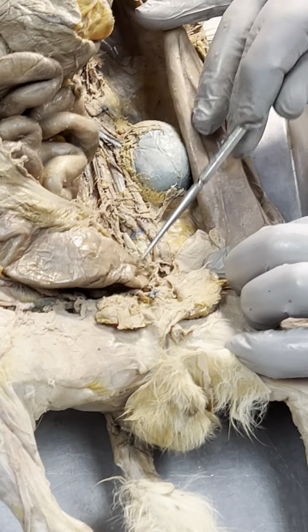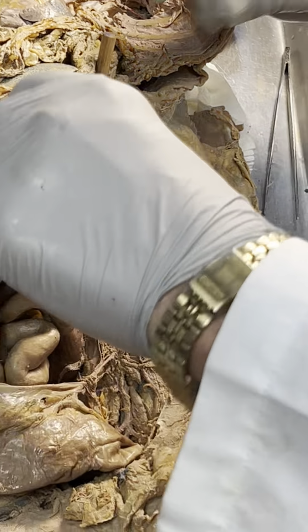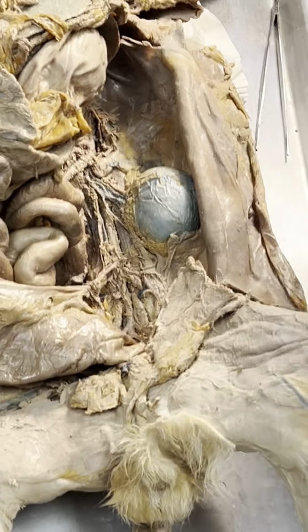And these down here, you're not going to see that. That's not cleaned up yet. Would you ask about them?